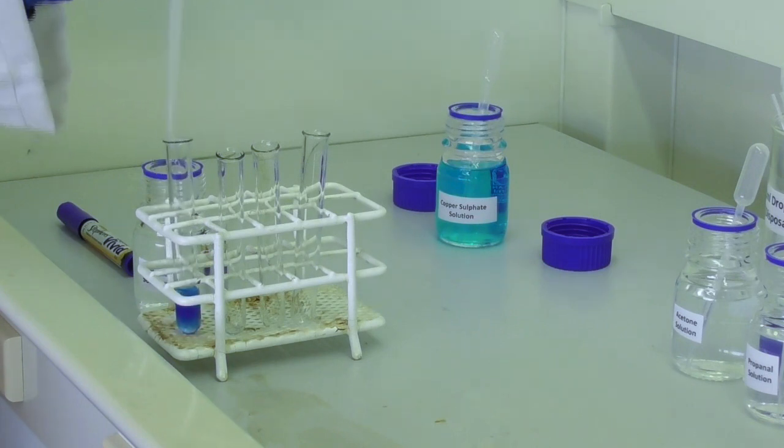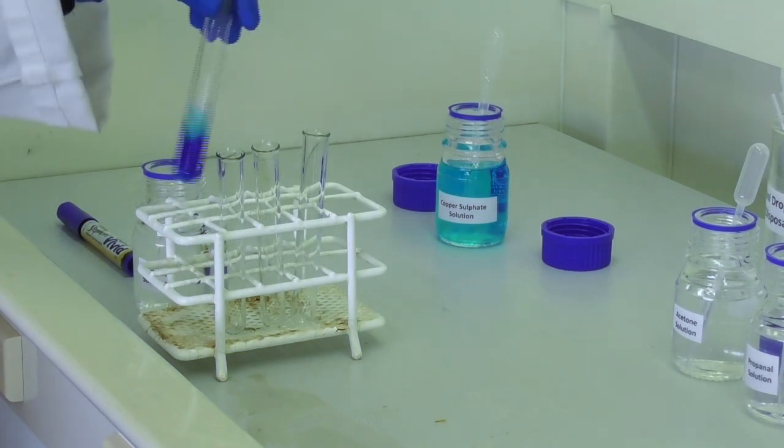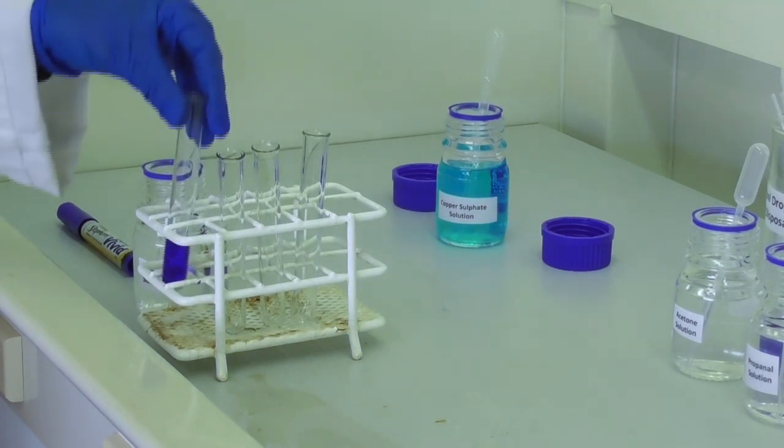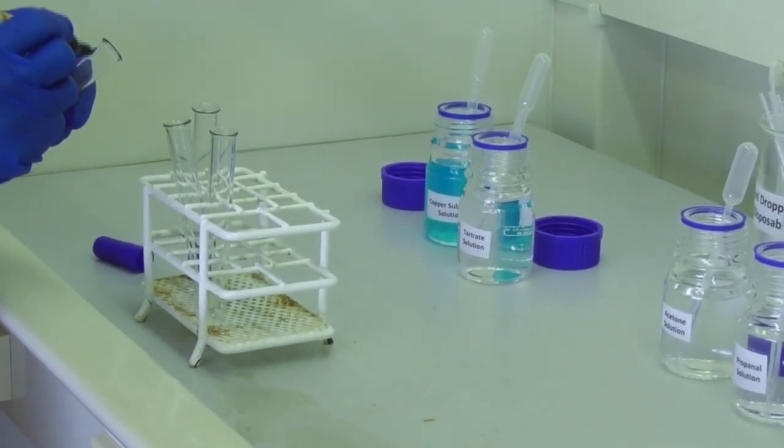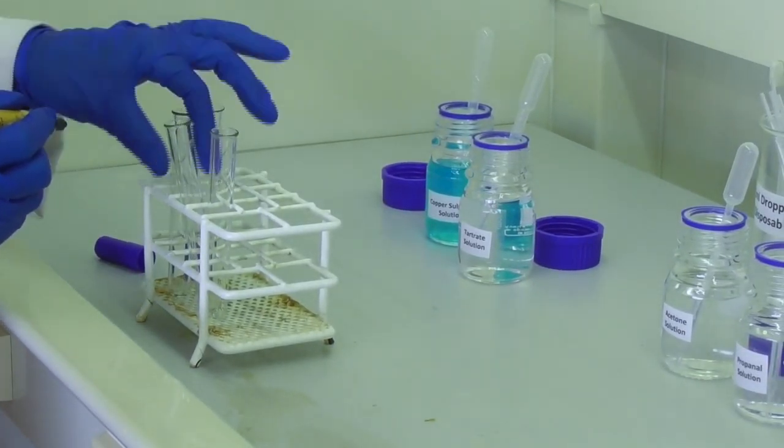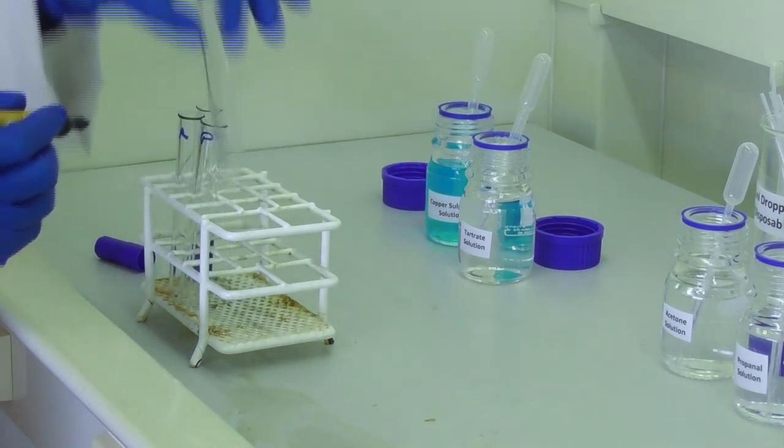This will result in a deeply blue solution in our test tube. For this test, we also want to label three test tubes appropriately, so we don't confuse them afterwards.